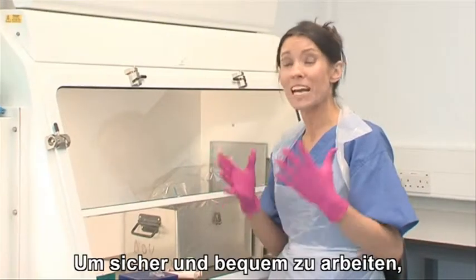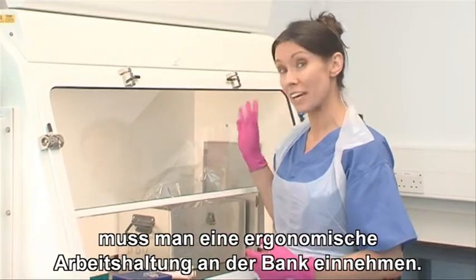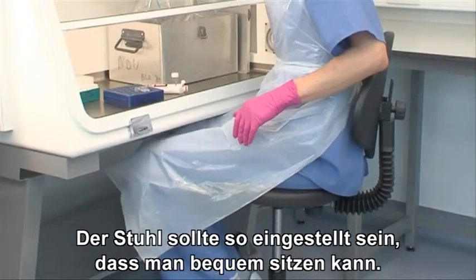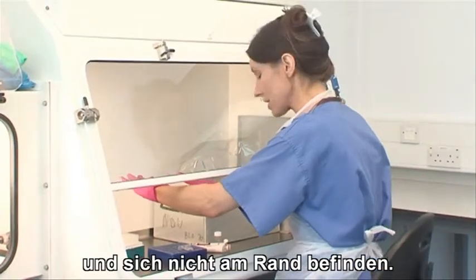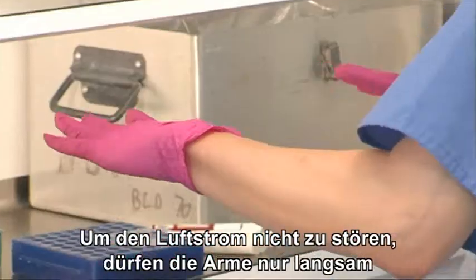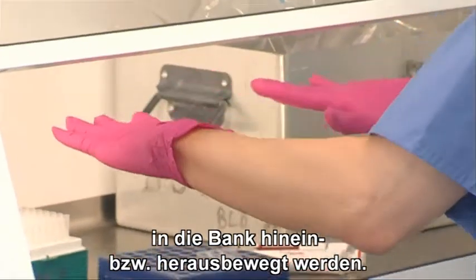For both safety and comfort, it's important to adopt the correct posture when working at a safety cabinet. The chair should be adjusted to ensure maximum comfort, with your arms placed well into the cabinet, not right on the edge. Your arms should be moved slowly to maintain the correct air inflow when moving them into and out of the cabinets.